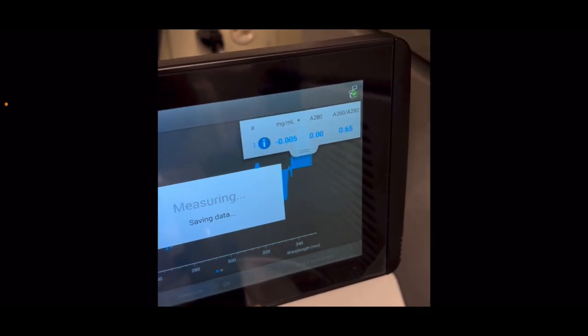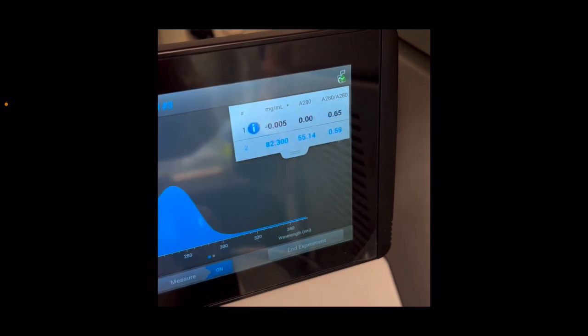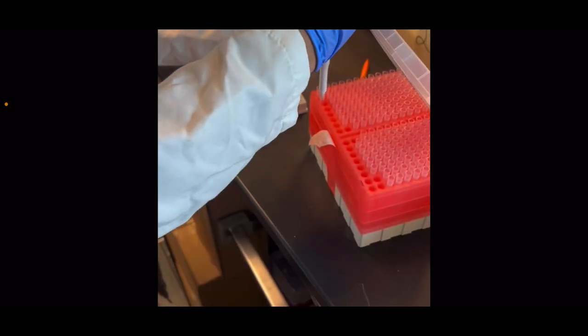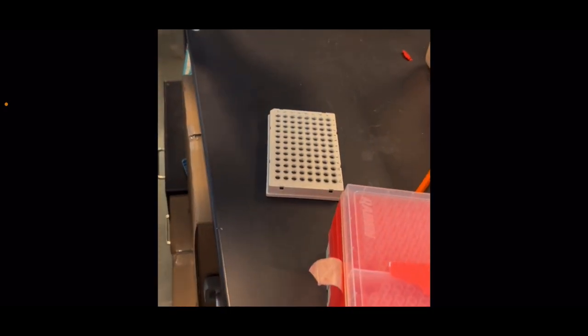As you can see, it's already zeroed, since you can see the 0.005, and the reading I'm going to be using for my initial reading is going to be 82.5 milligrams per milliliter.